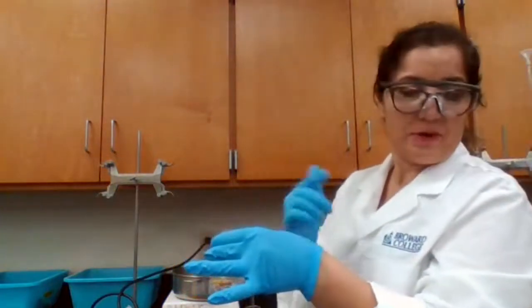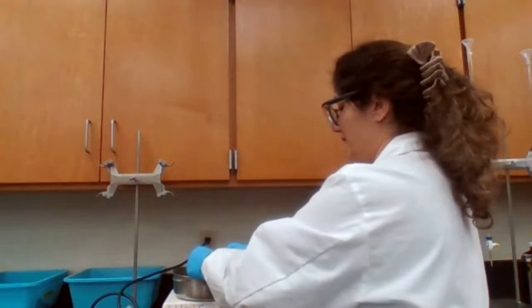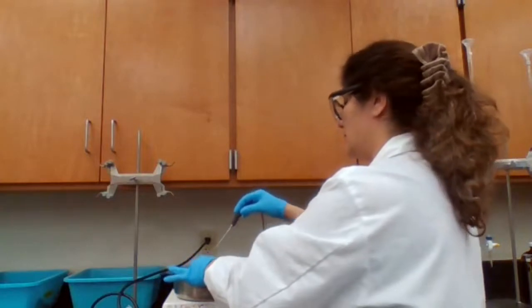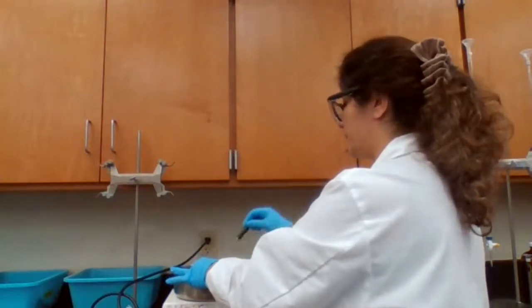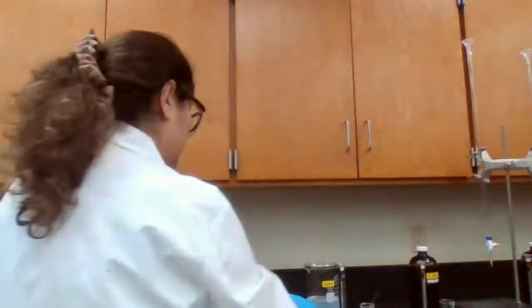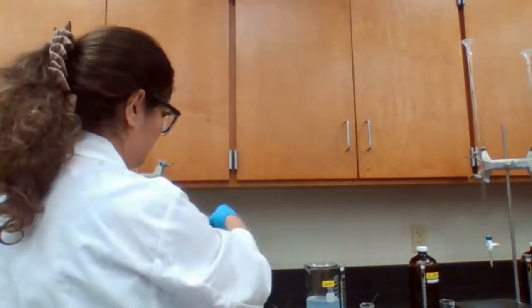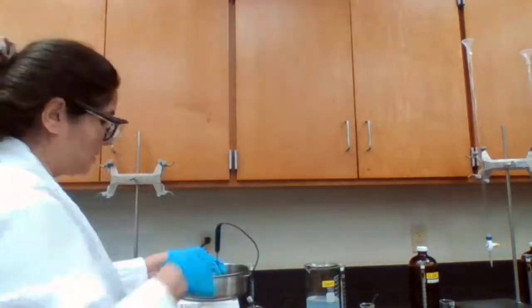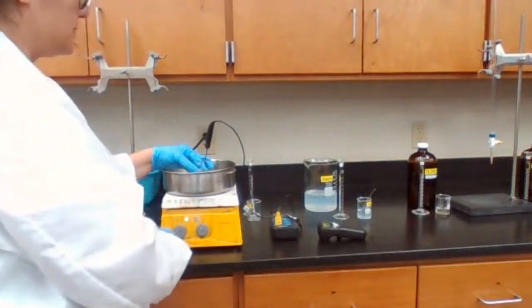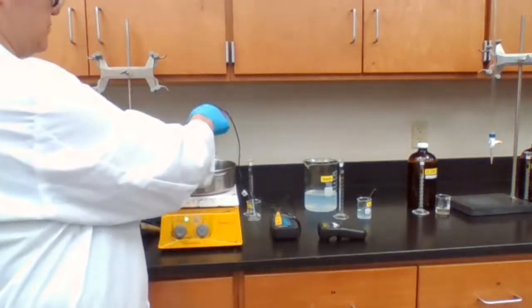This should take much less time compared to the other two, so it should be less time compared to trial 5 and trial 6. So I'm going to look for the temperature in one of the flasks. Wait until it reaches, this time I was 35, should change to 45. So I'm holding both flasks in the hot water bath, monitoring the temperature, making sure that it reaches 45 degrees Celsius, about 45, or 44.9.